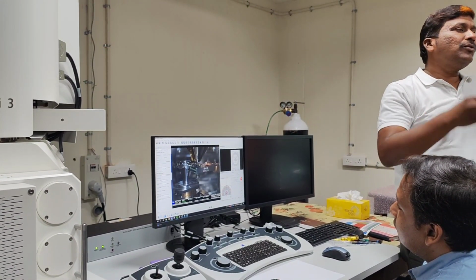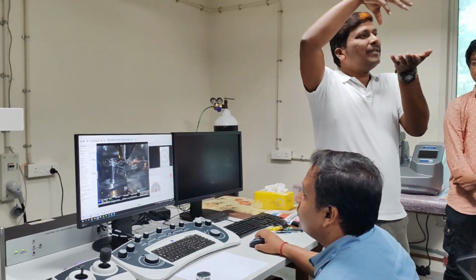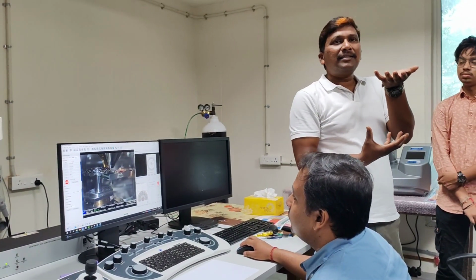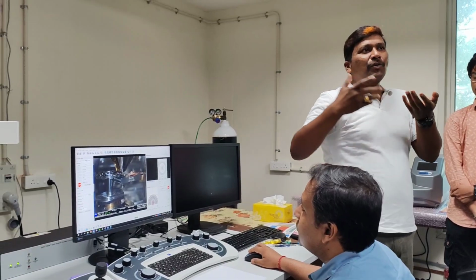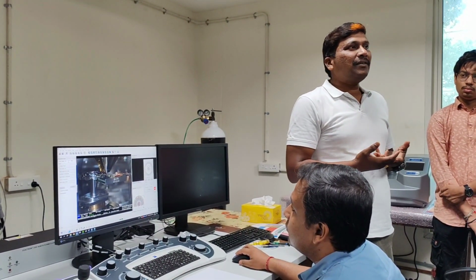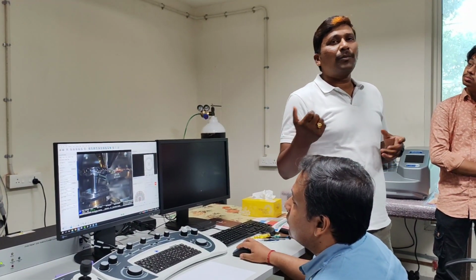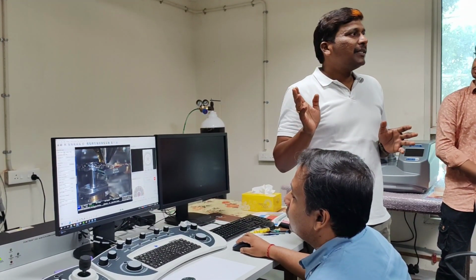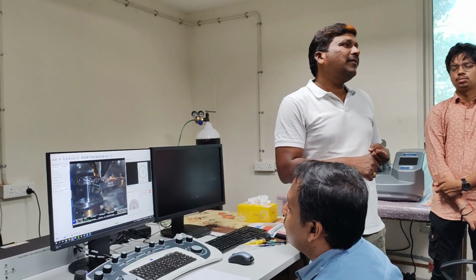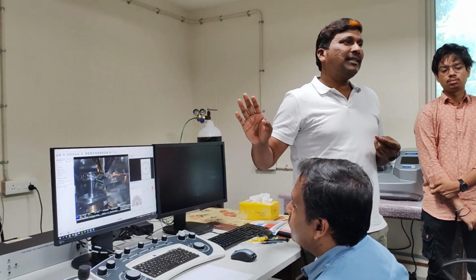So in TEM, the sample is so thin, and your source is on one side with the sample in between, and your detector is below the sample. Similarly, in SEM also, people call it a poor man's STEM, because a TEM slot is hard to get, or TEM itself is a very expensive tool. Here the only limitation is that this can go up to 30 kV only, whereas for TEM, a bio TEM can go up to 120, materials TEM people have 200 kV, and HR TEM people have 300 kV also. Yes. But the only limitation here is the kV.